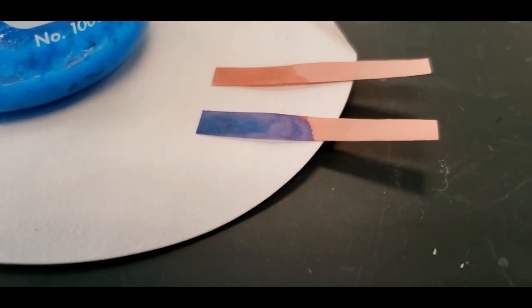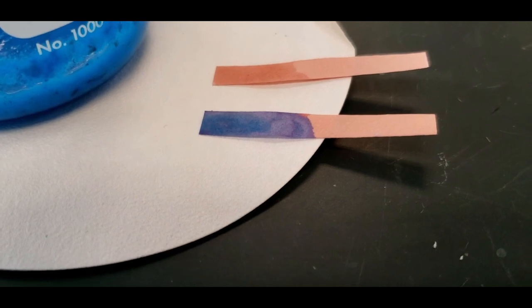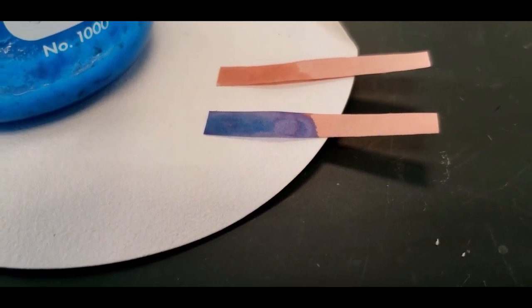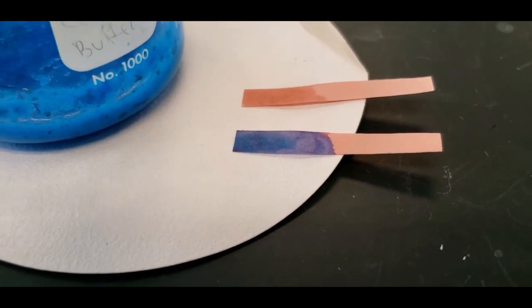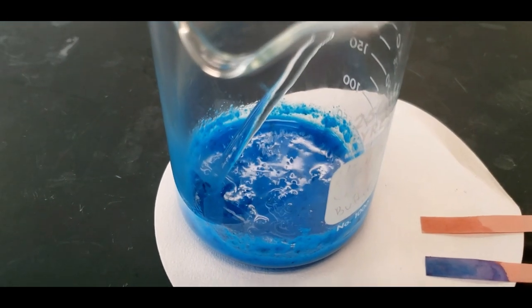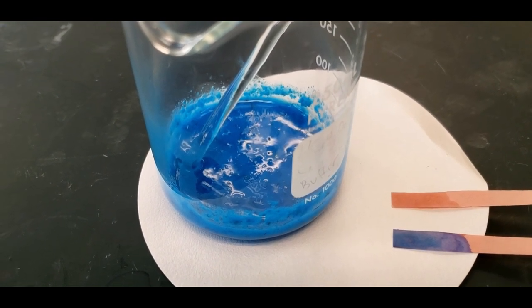After I added in some more sodium hydroxide and touched the paper, now you see that it's blue. There's also the blue due to the copper two hydroxide, so this is a little tricky. You can see where the copper two hydroxide solid is, but then you can also see that the liquid leached away and became that purple. That means it is a basic pH. So we got what we're after. That's the next form of copper, and we'll go on to the next reaction.